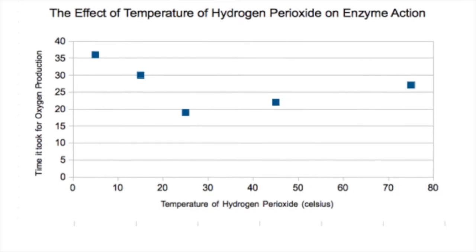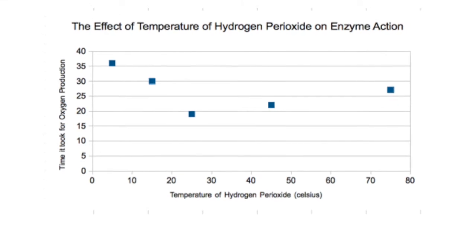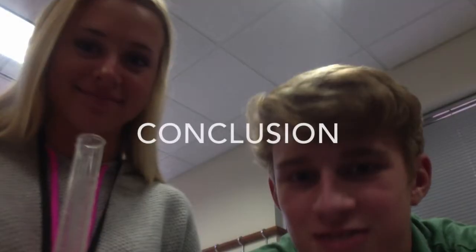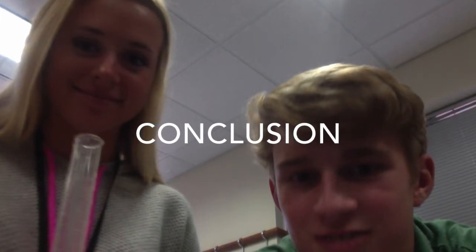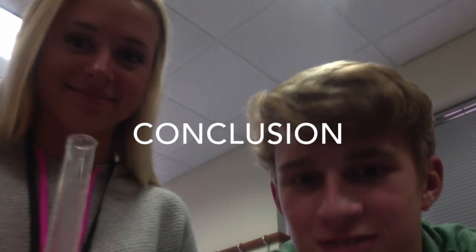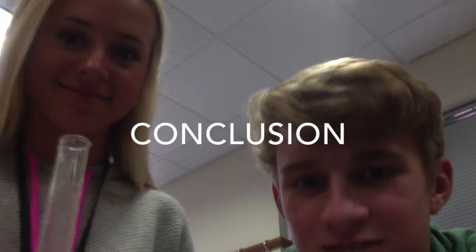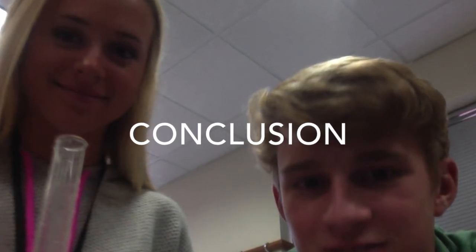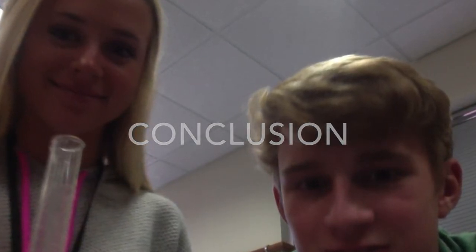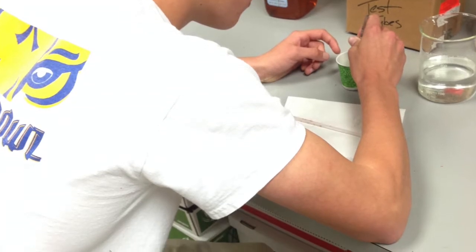As you can see in the graph, the oxygen production was most effective at 25 degrees Celsius or room temperature. Based on our data, the colder the temperature, the longer it takes for the paper circle or substrate to rise to the surface. For example, when the temperature was 25 degrees Celsius or room temperature, it took 19 seconds for the substrate to rise. When the temperature of the hydrogen peroxide was 5 degrees Celsius, it took 36 seconds for the substrate to rise. And when the hydrogen peroxide was 75 degrees Celsius, it took 27 seconds for the substrate to rise.